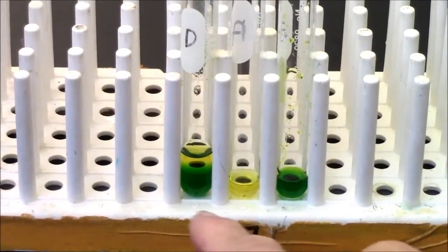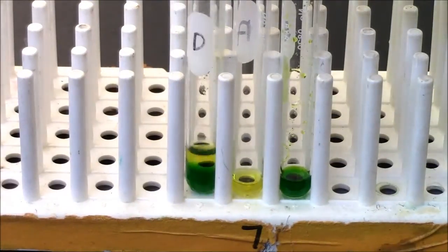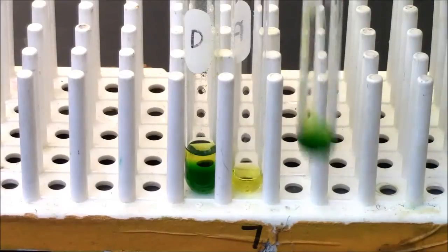Here's a close-up of my partial separation. I still have the mixed two layers there. Here's the top layer, here's the bottom layer.